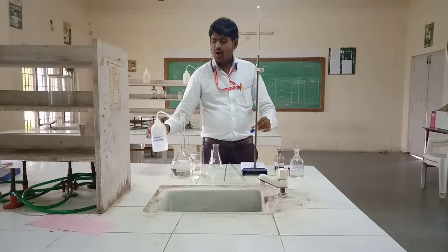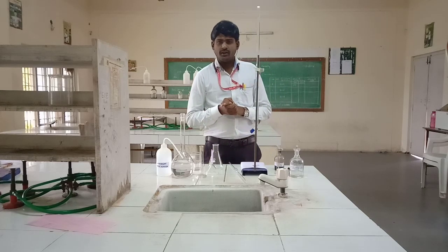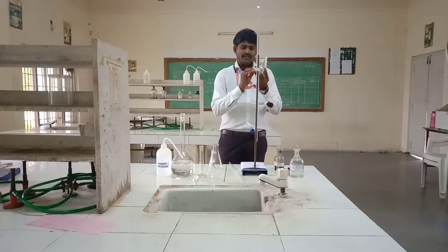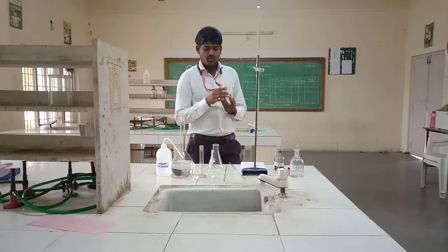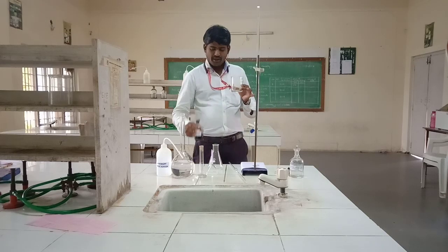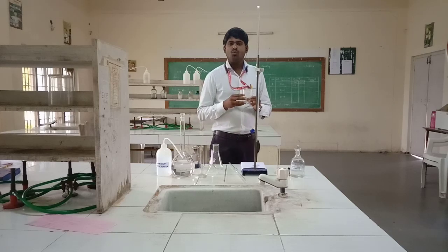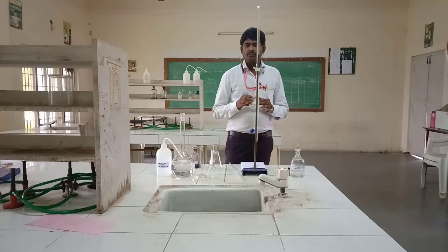And one more chemical: the hard water sample. In this experiment, the principle is: first take the hard water sample. In this hard water sample, calcium and magnesium salts, carbonates, and bicarbonate salts are present. These calcium and magnesium salts react with EBT indicator.